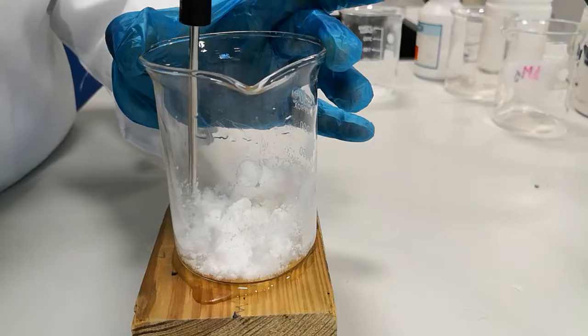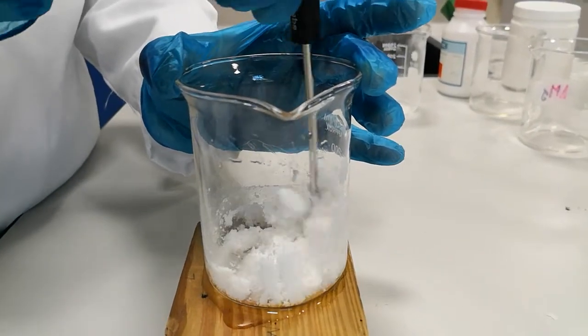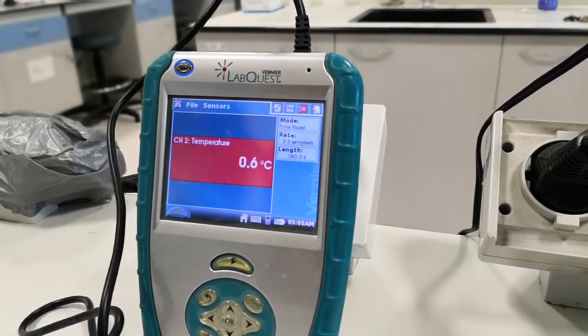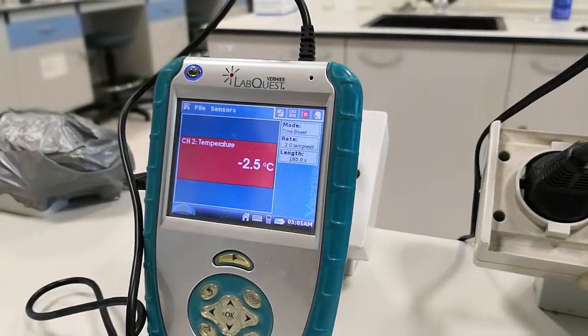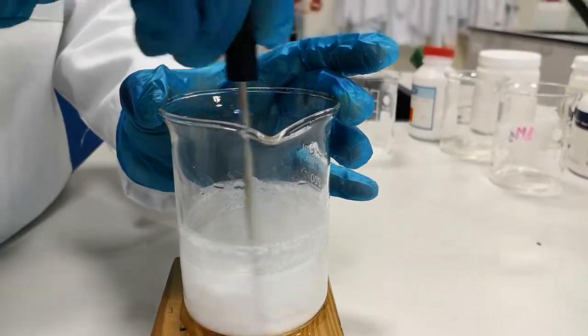The reaction is very fast. The temperature started to drop. It is going to go below zero. At this point, water will freeze.